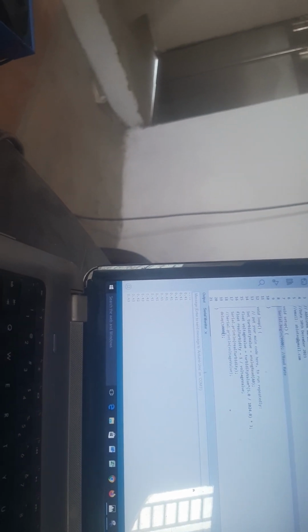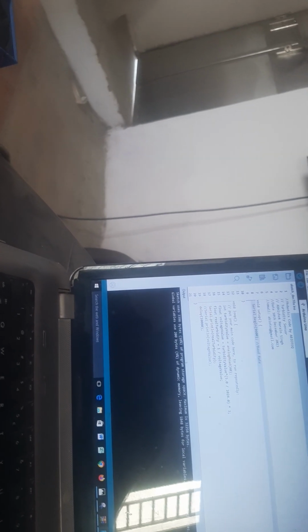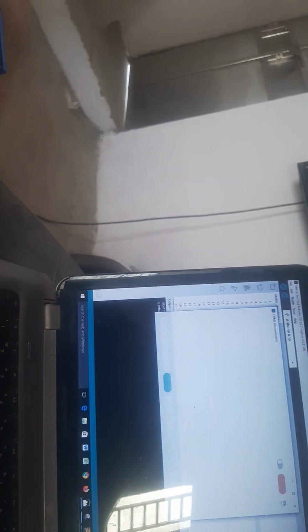And then the task is very simple. I just need to verify my script, and it looks like it has been verified very successfully. Then I upload the code to the Arduino board, and as soon as the data has gone over there, then we simply have to let me try this again. Okay, so it has started, and then I have to see the plotter.